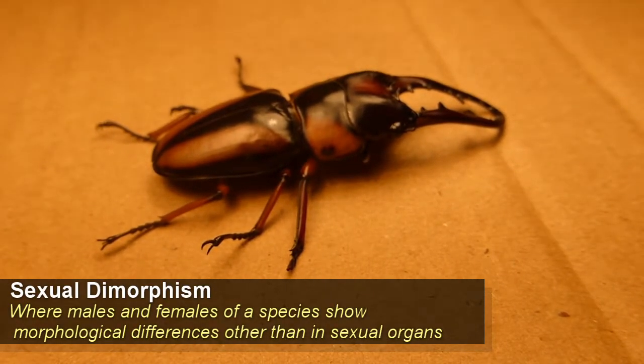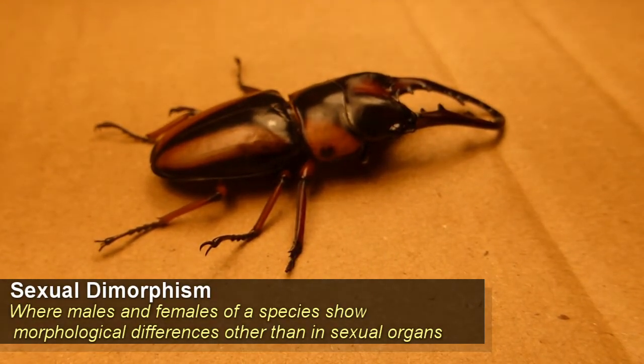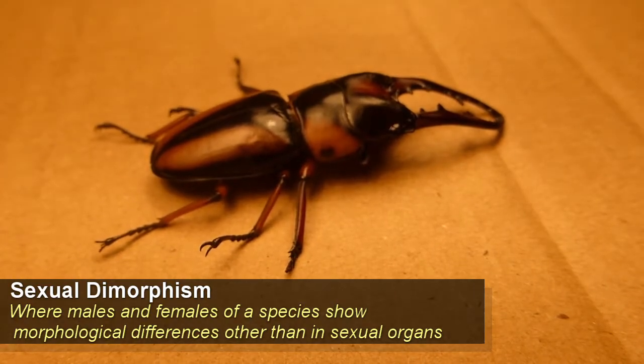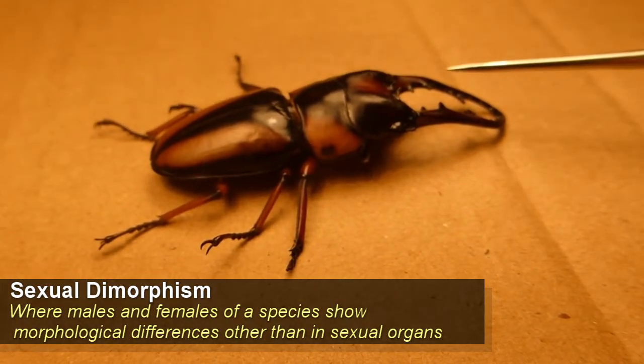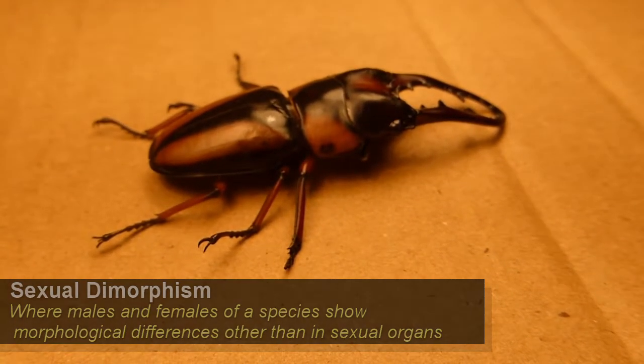Stag beetles display sexual dimorphism, meaning that the males and females look different. These antlers are only present in the male ones.